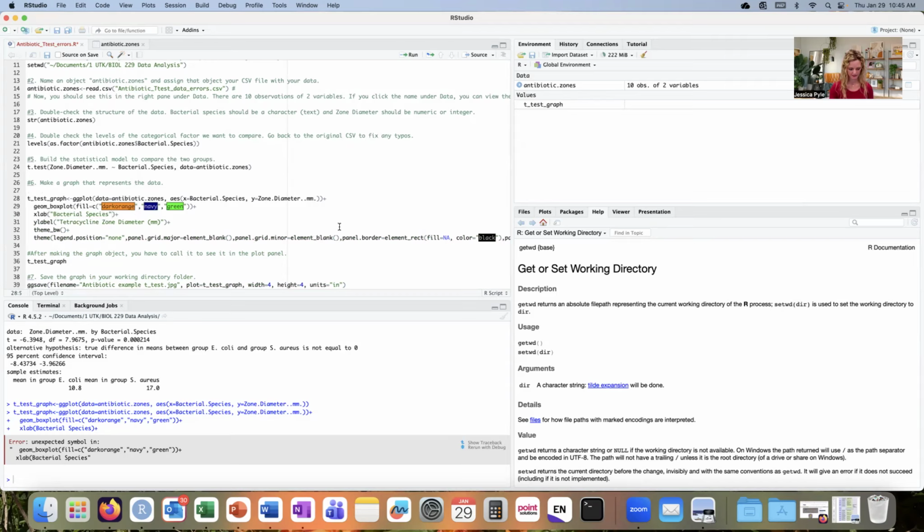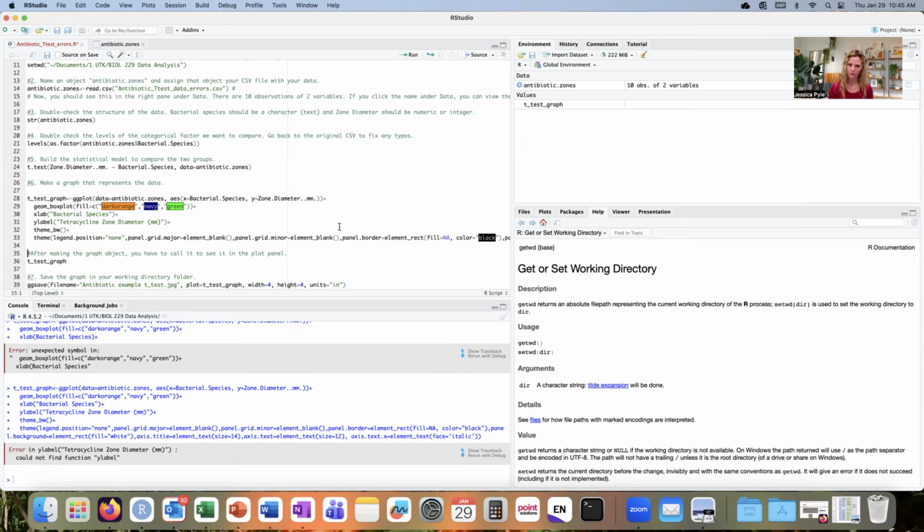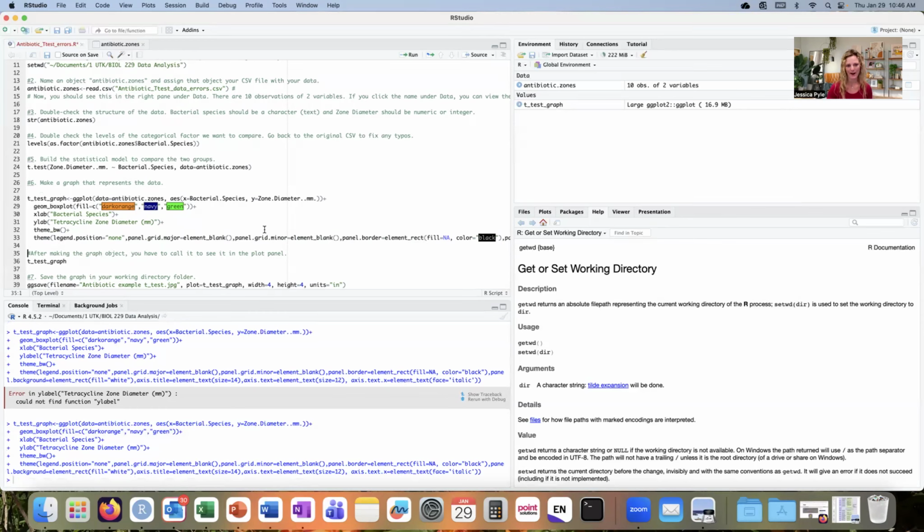Okay, so now we can run this line, and we have one more issue within this code for making the graph. It says error in Y label. Could not find function Y label. That means I've mislabeled my function name. So the function is xlab or ylab. If I type the whole name label, that's not a valid function name. So I need to make sure I'm using a valid function name, in this case, xlab or ylab. Now I'll try to run line 28 again. And this time there's no error messages.